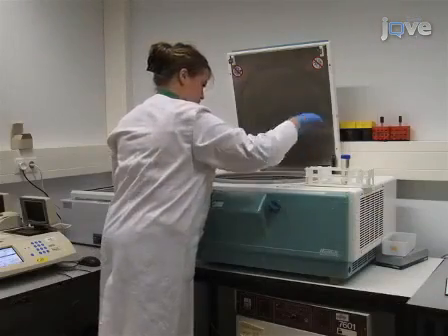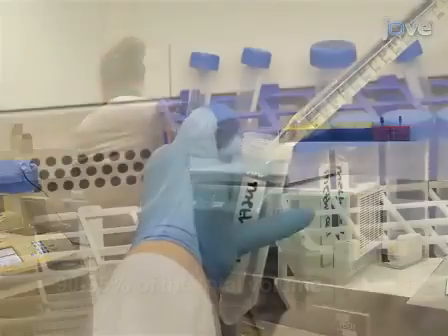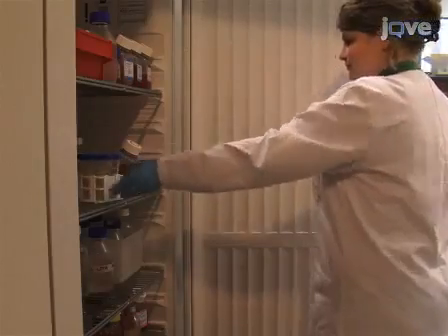The next day, clear the solution by centrifugation at 5000 G for 2 hours at 4 degrees Celsius. Transfer the clear, highly viscous solution to a new tube. Store at 4 degrees Celsius until use.